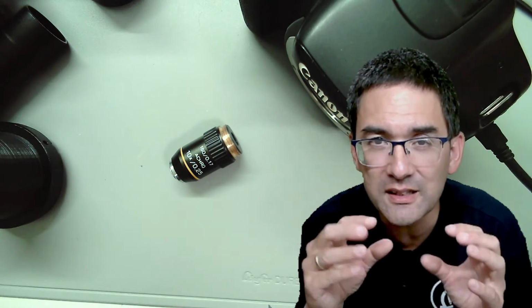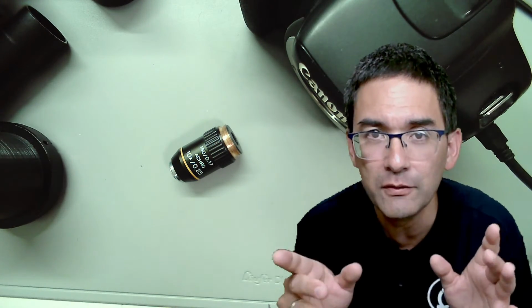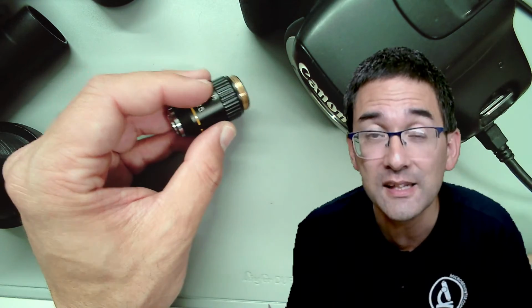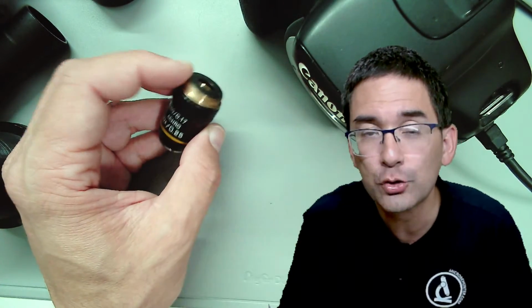It's not going to be quite as clear, and the colors are not quite perfect. The reason is that even though you use white light, different light rays are refracted differently by the optics. That's why objectives have up to 10 lens elements to correct all of those lens errors, to make sure that the image is sharp. And this is chromatic aberration.